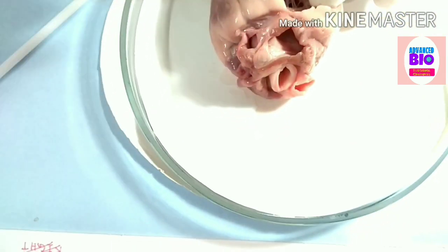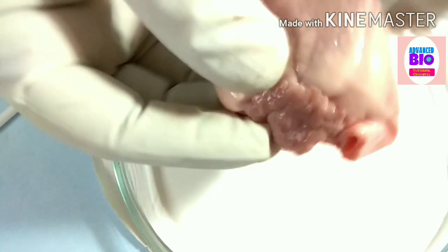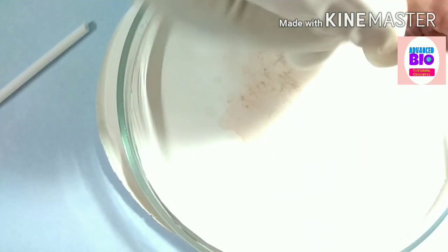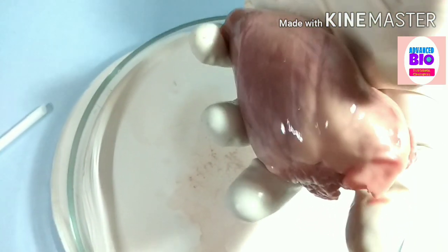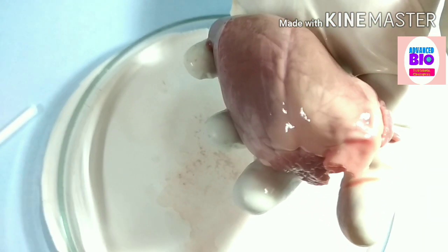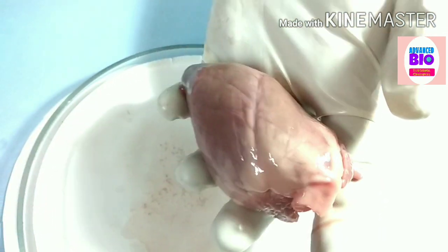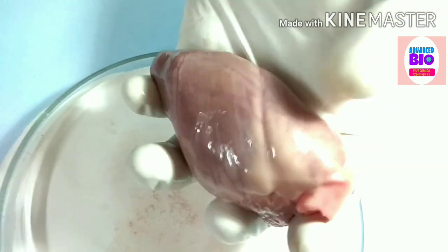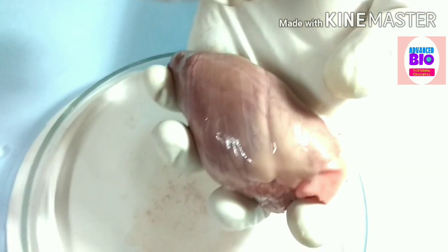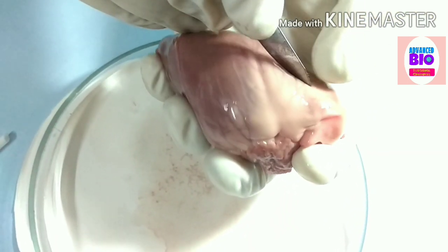Now come to the right side. I have to give one more incision on the right side, like this.